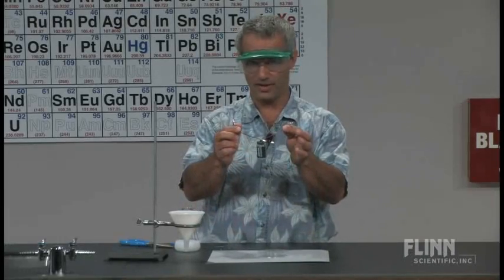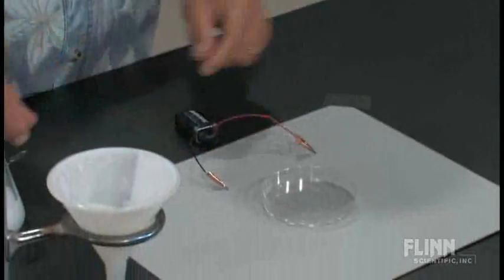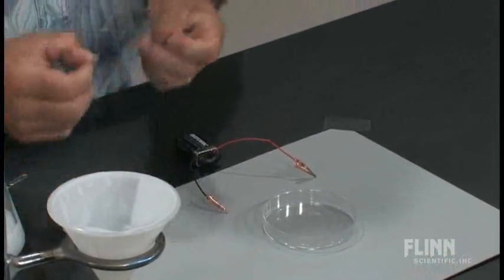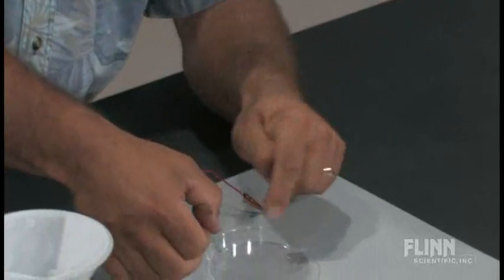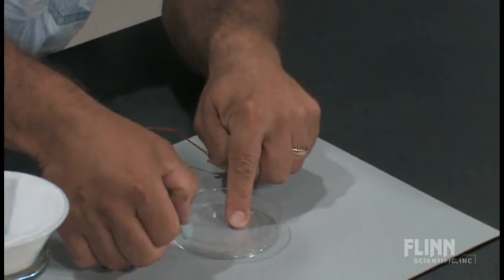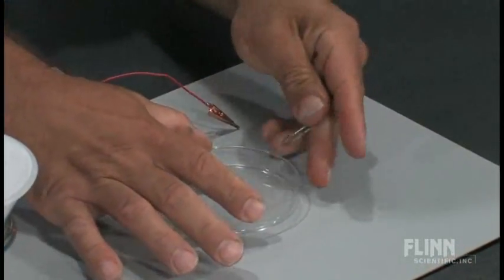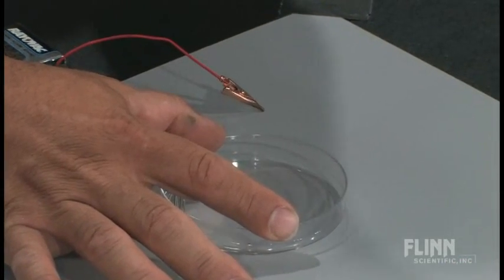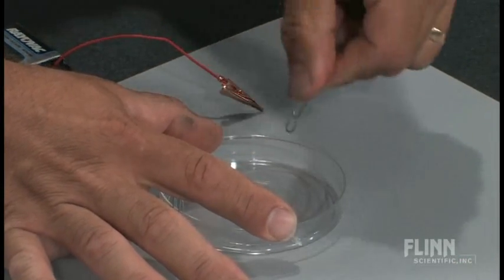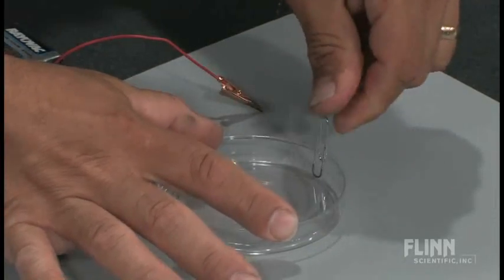I've got the electrolysis as a simple setup. It's a 9-volt battery with battery clips on the leads. And for my electrodes I'm simply using little paper clips that I'm going to affix to the Petri dish. You want to put the long end of the paper clip on the inside so that it can go down to touch the solution.